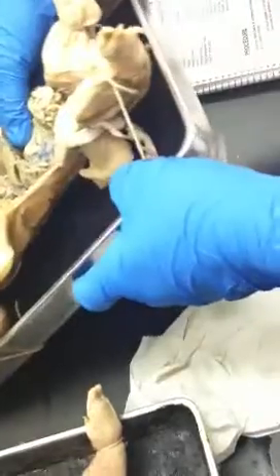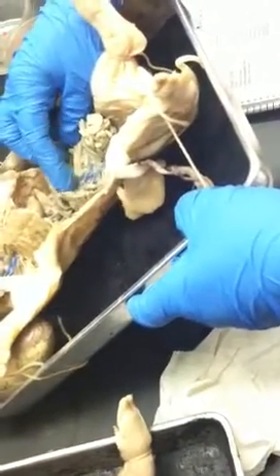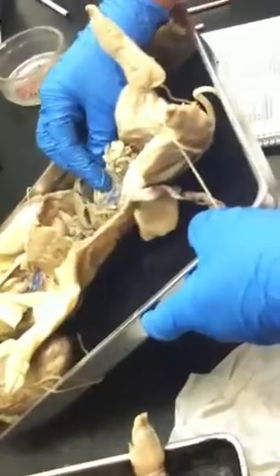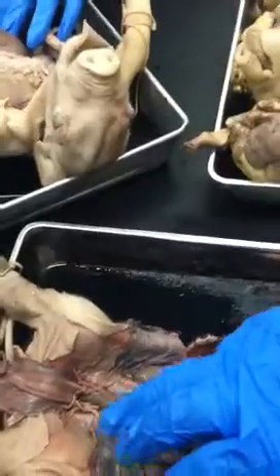So in this pig, you're looking for something coming out of the small intestines up to the liver. See, that one, at least it's dyed. This guy has one, but it's not dyed. From there up to there. Okay.